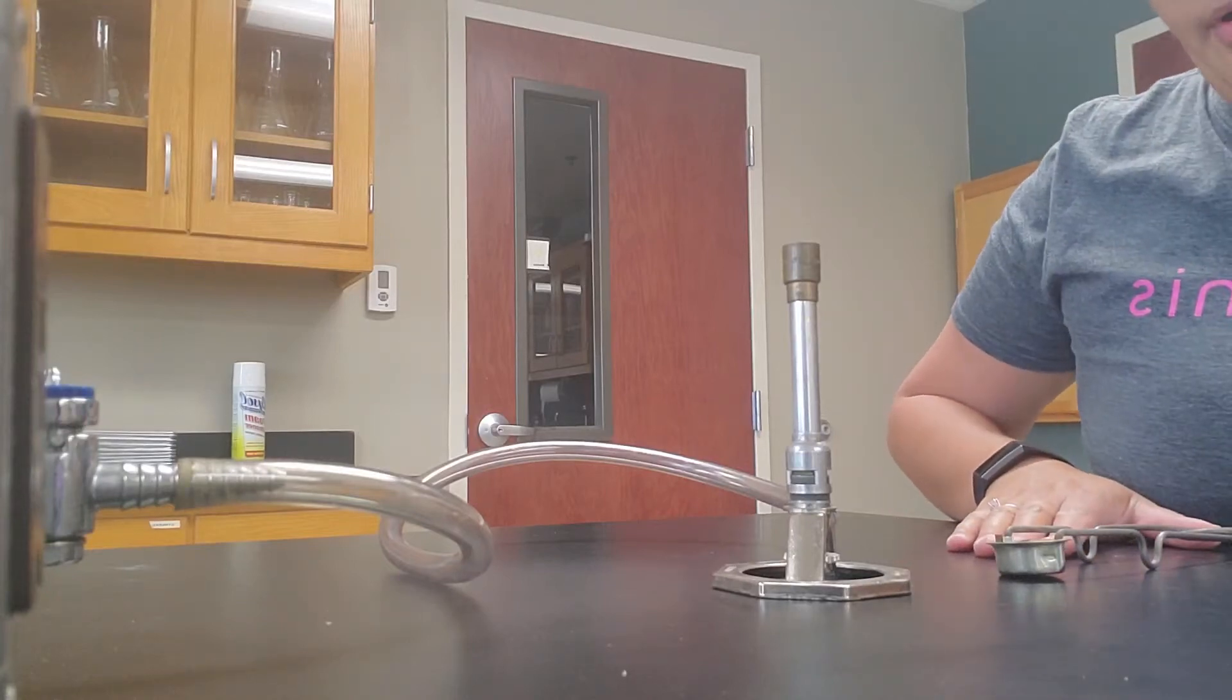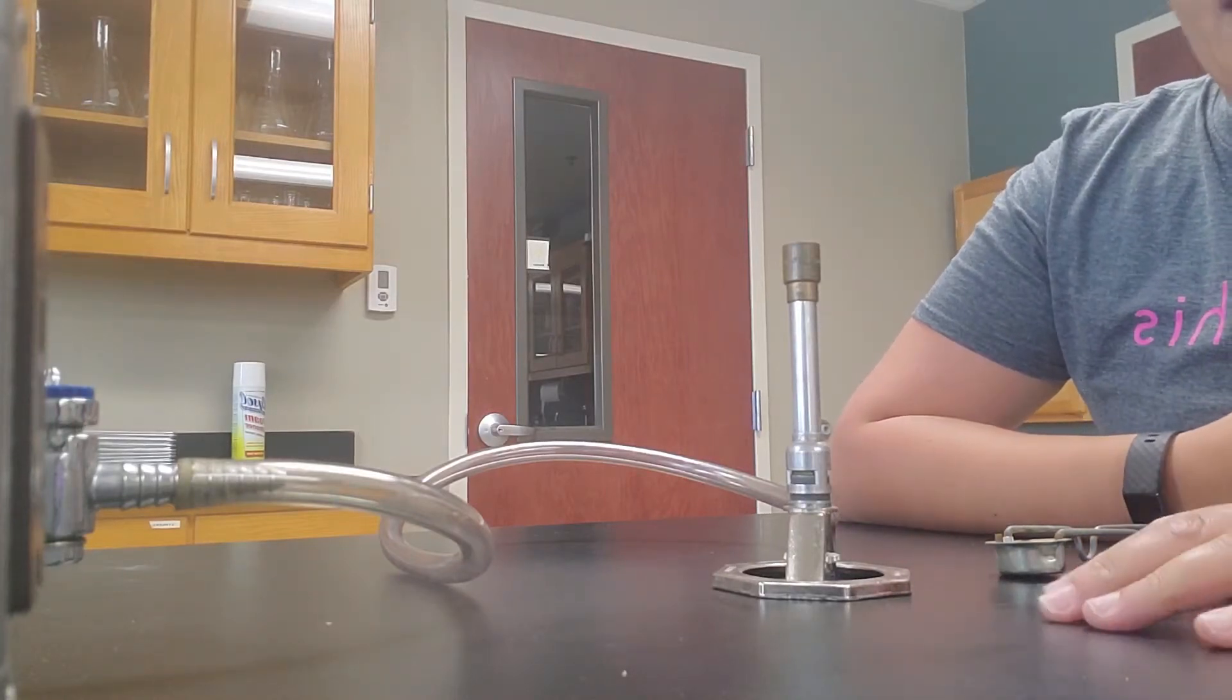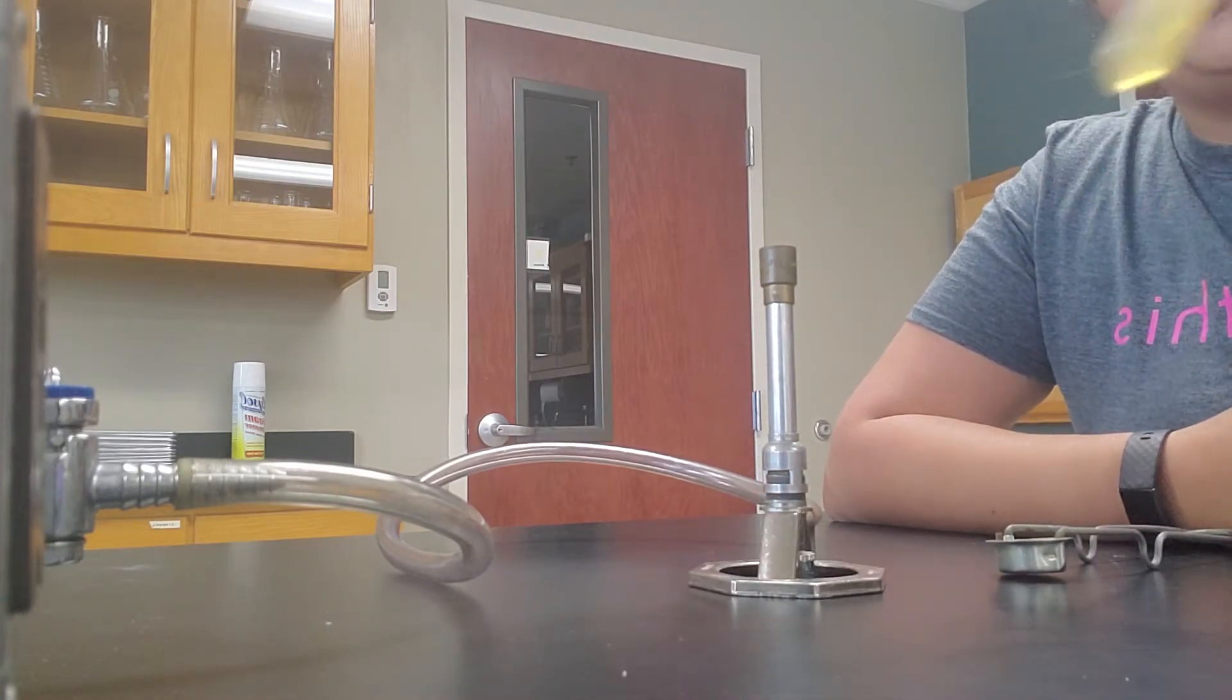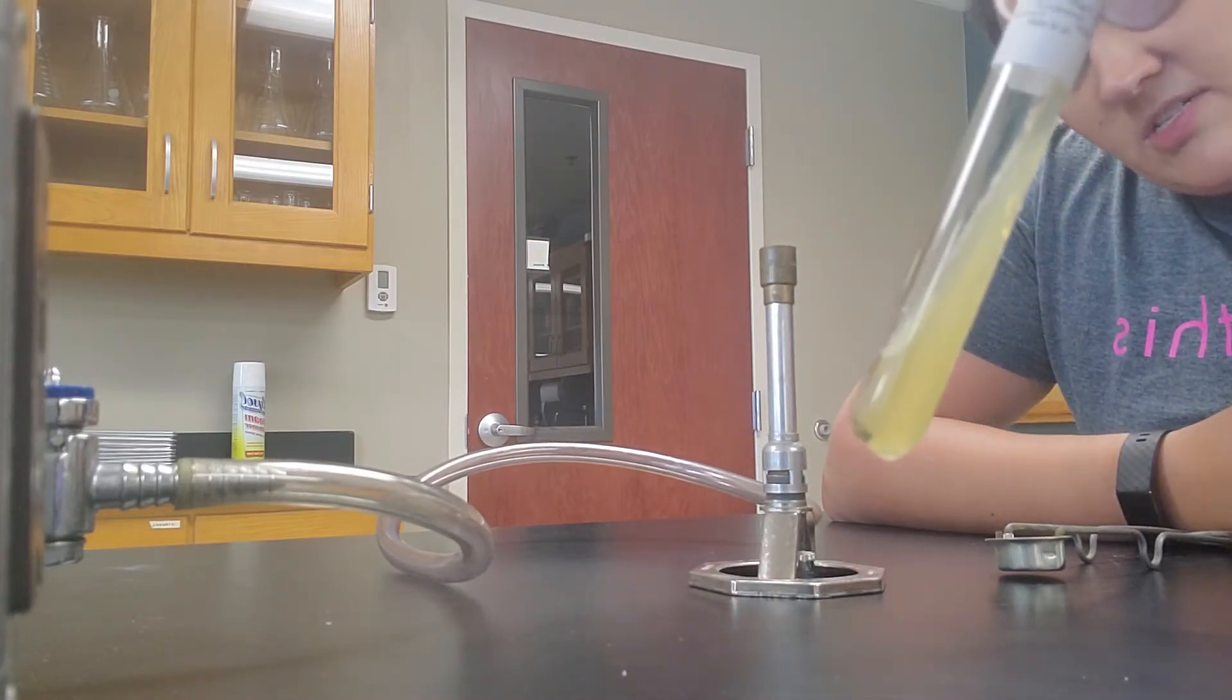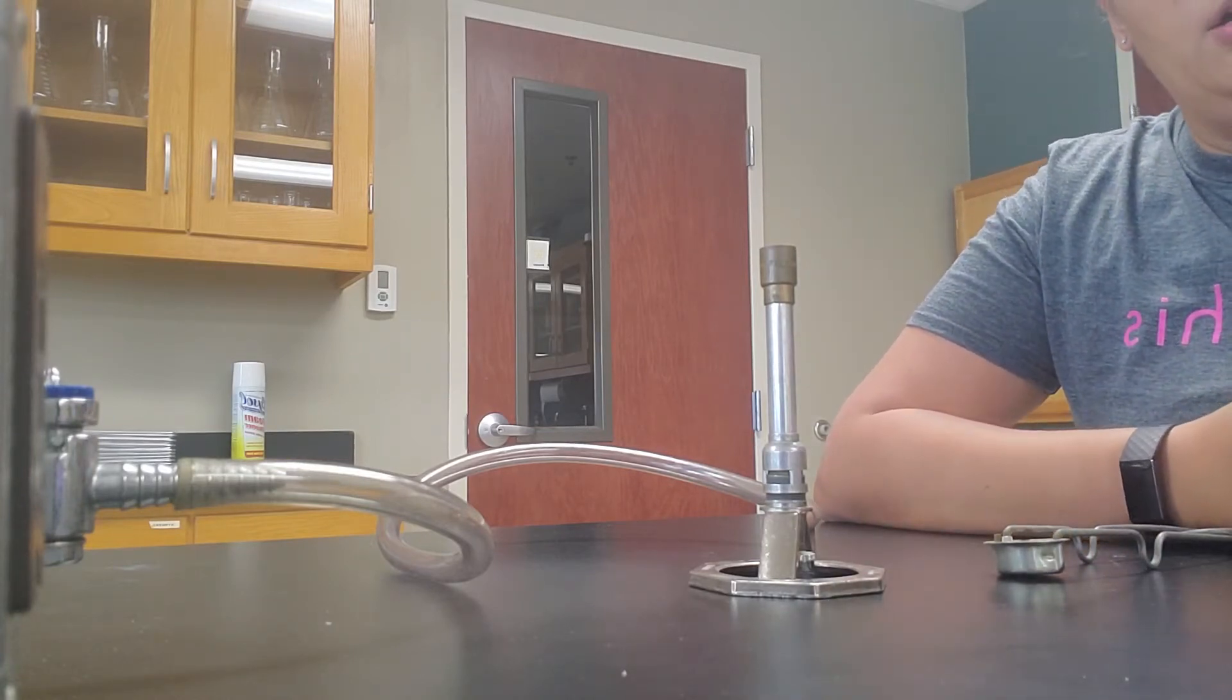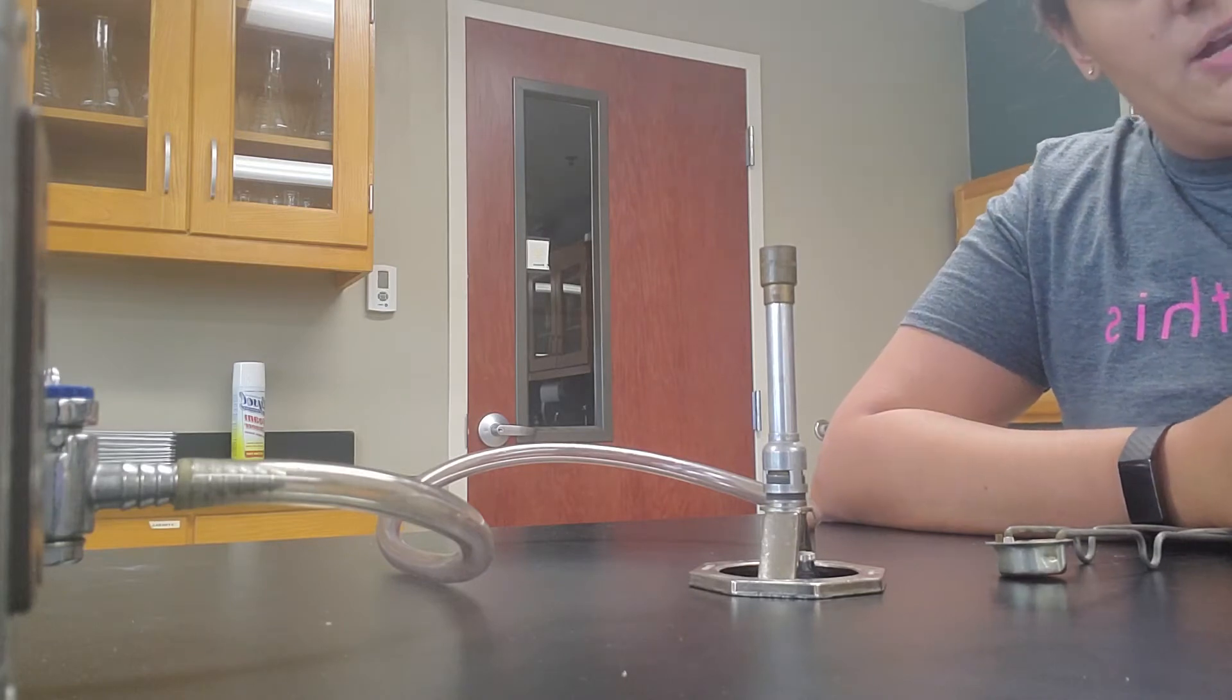Okay, so today we're going to talk about aseptic technique and how to do a culture transfer. I'm specifically going to be doing a culture transfer from an agar slant, which you can see solid media at a slant, to a broth tube. So that's what we're going to be doing.